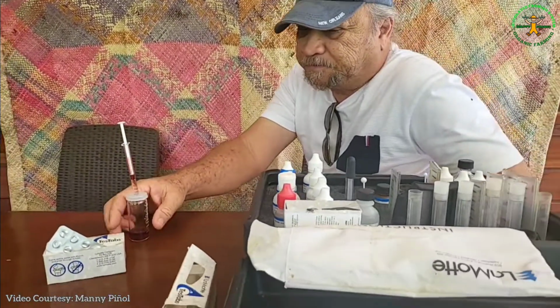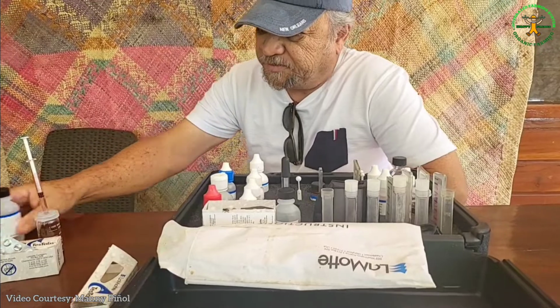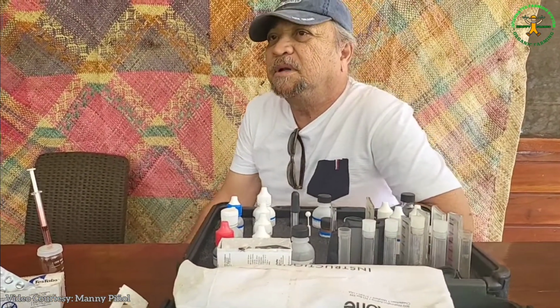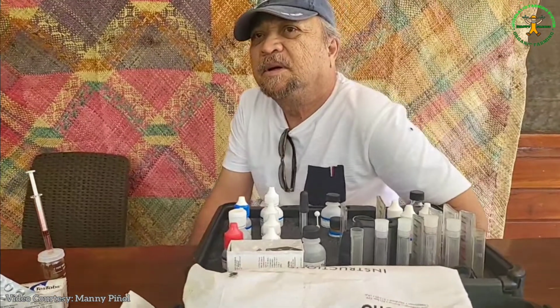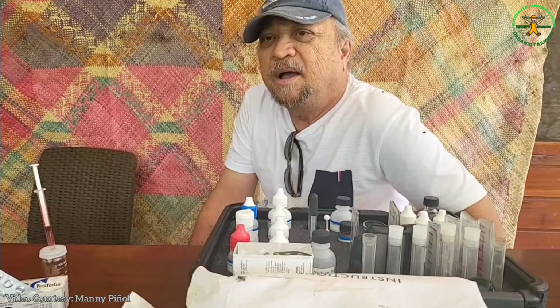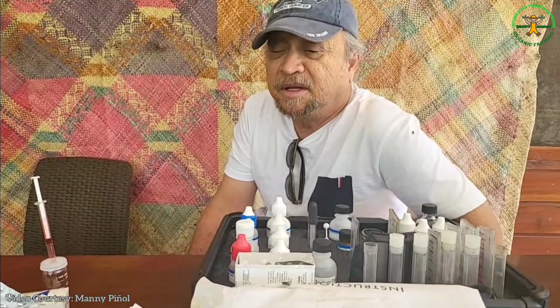Now, using this simple kit, what about the seawater? What do you need to test? What do you want to determine? We got some samples of seawater from Tukuran and Sultan Naga de Boporo. Unfortunately, I don't have my refractometer. I left it in my place in Davao.